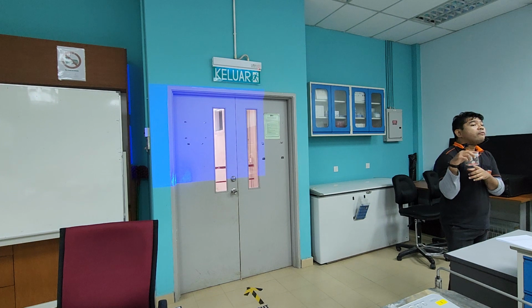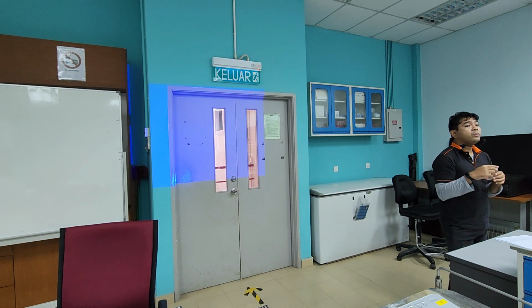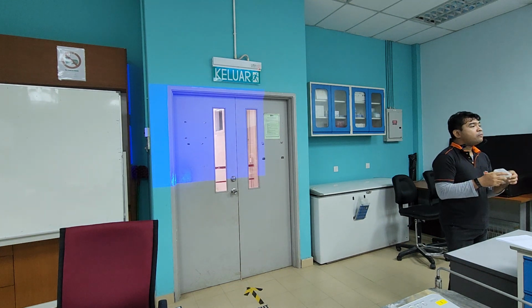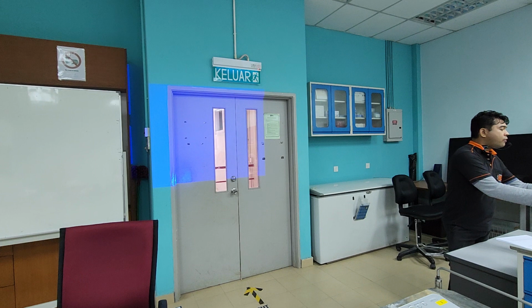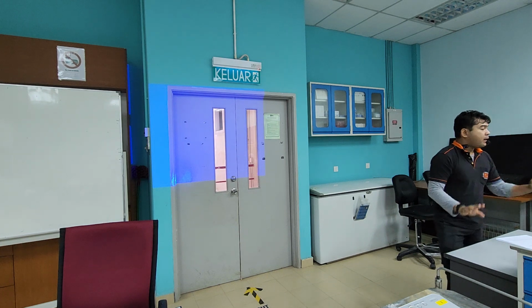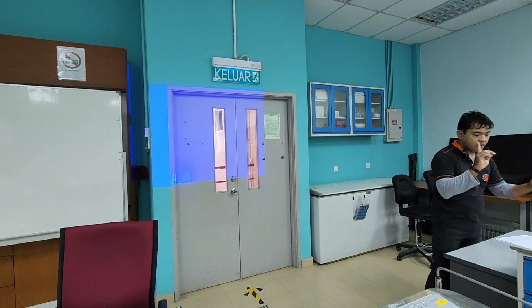Because this is corn. Corn is quite fast. If it's big enough, you can harvest some of the biomass as your T1, right? And then the following week, harvest some more for your T2. Then you're done with it, okay? So for this activity, simply involve germination only. You got your seeds, you got your germination, okay? I'm not going to explain just yet what's to be doing here.